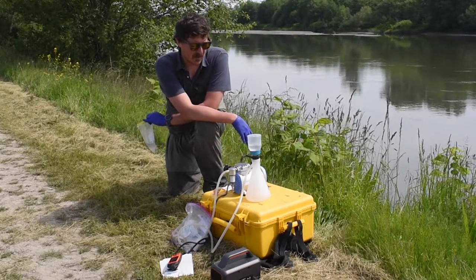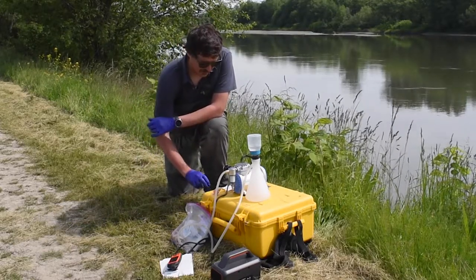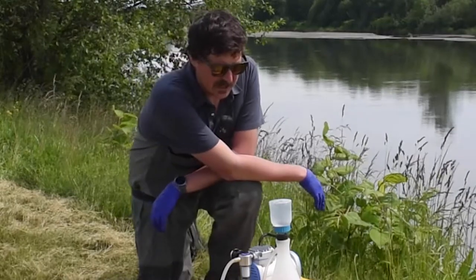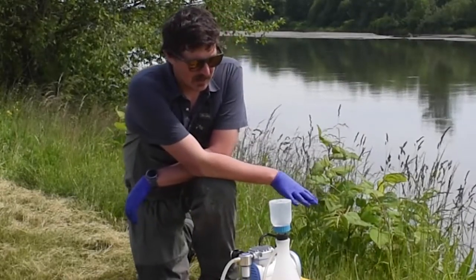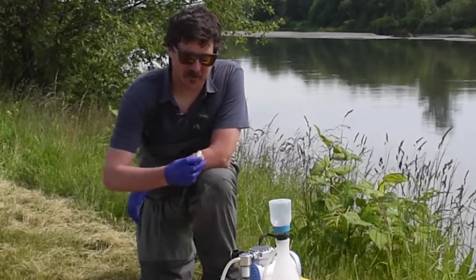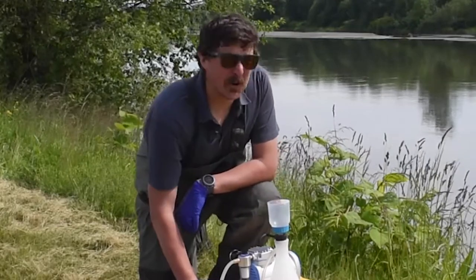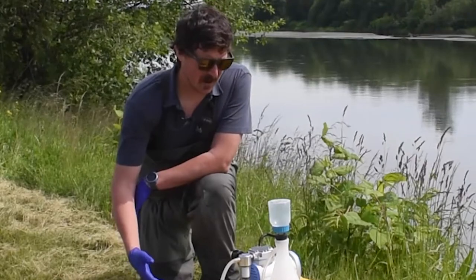Once this gets to the end — that's all I'll do for brevity here — once you get close to done, you start watching. Once the water goes all the way through, I like to let the pump dry out the filter a little more. Once I pull the filter out of the filter funnel, I'll be putting it in this Whirlpack bag with silica, because we're concerned about deterioration — moisture can deteriorate DNA over time.